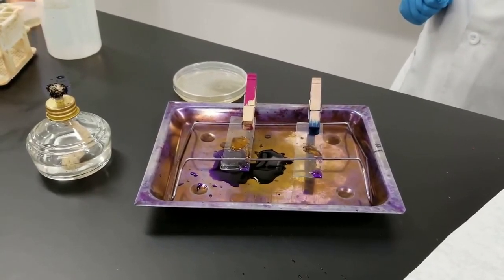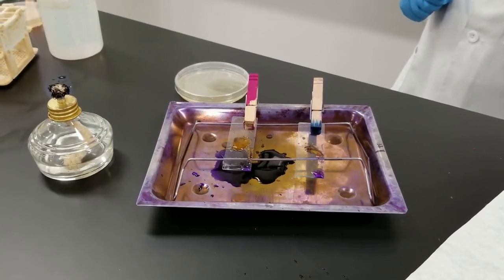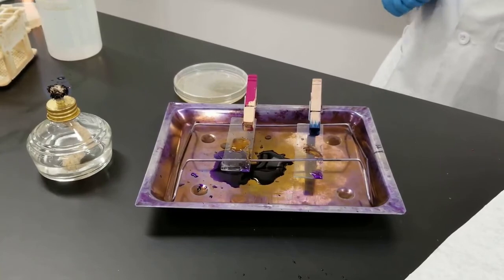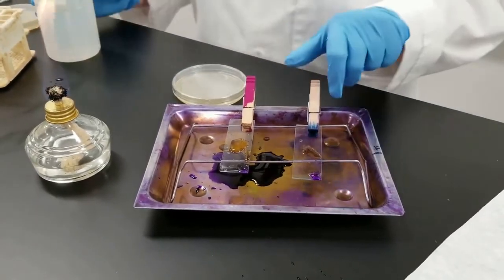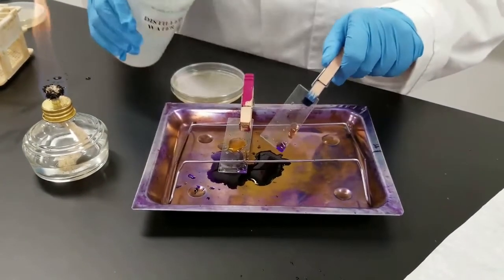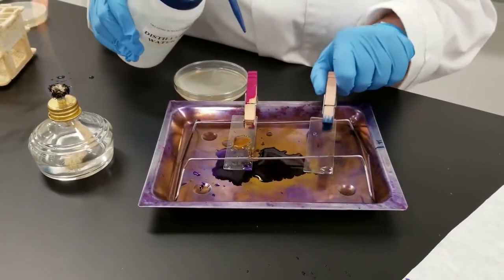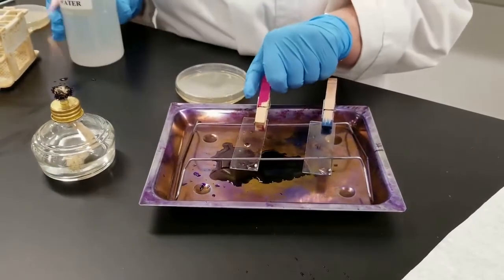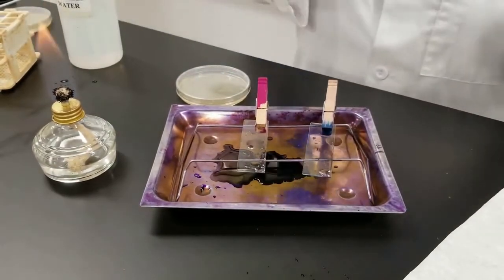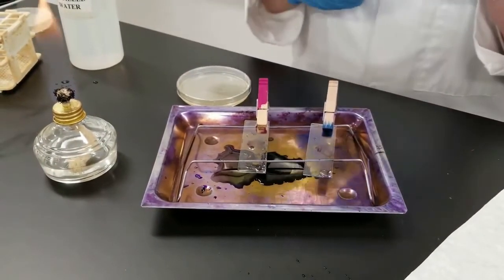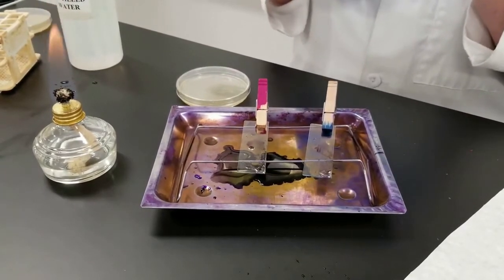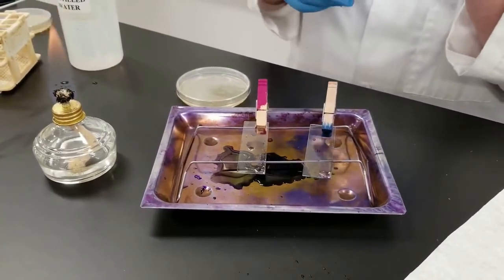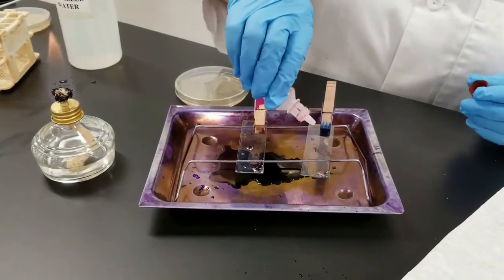So Crystal Violet was a minute, rinse, iodine's added, on for a minute. And now we are going to rinse that off once again with distilled water. Now, the third step is ethyl alcohol. Some people say add this on for 15 seconds, rinse it, do a second 15 seconds and rinse it. I prefer to add it on for 30 seconds.